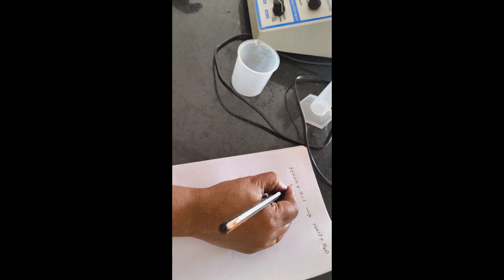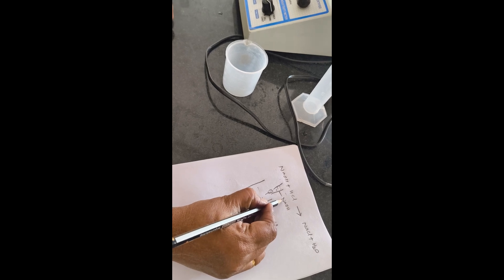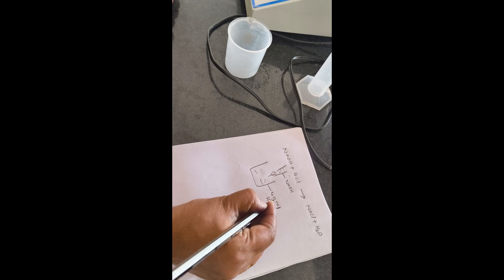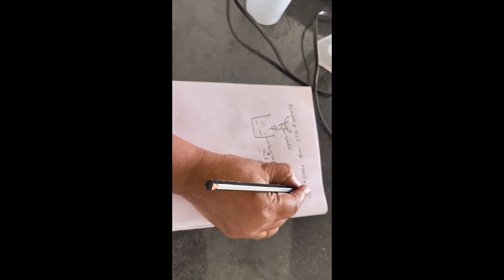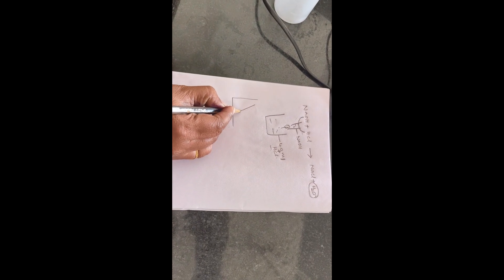Before base is added, the conductivity of acid solution is high because of the high mobility of H⁺ ions. When we are adding NaOH from the burette, the high-mobility H⁺ ions are combined with OH⁻ ions to form a water molecule. At this time, the solution conductance decreases — that is why the readings decrease.